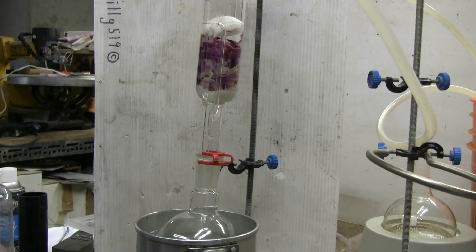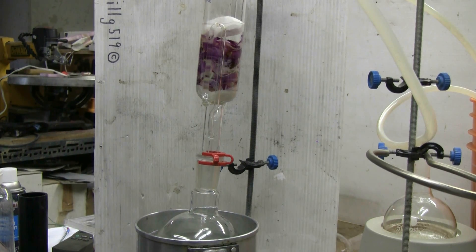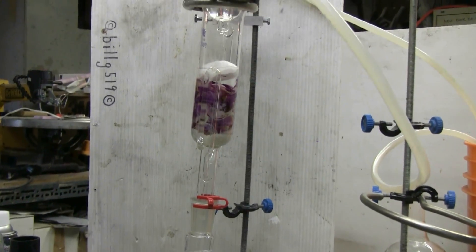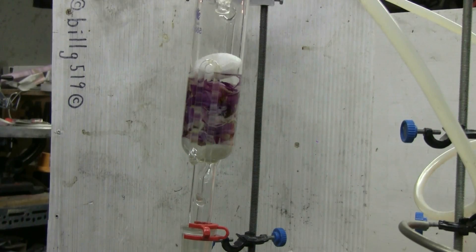Cycle number five is about to siphon. There it goes.